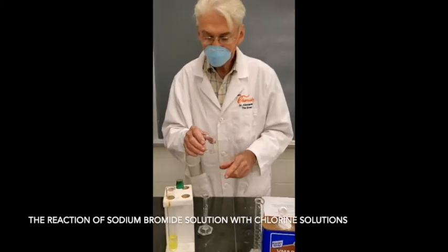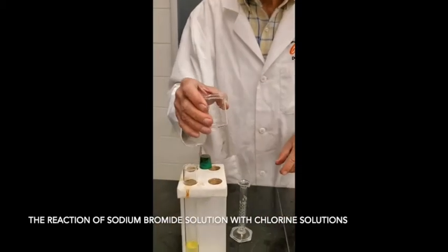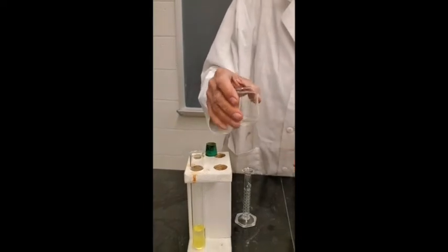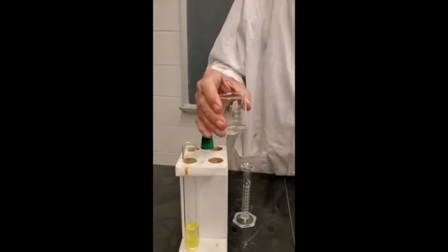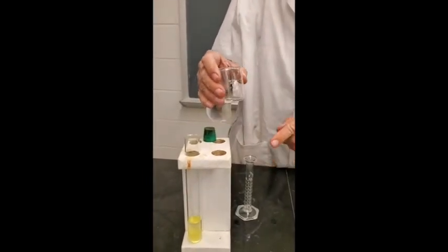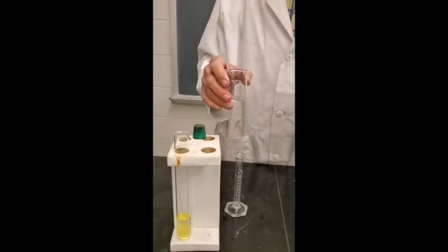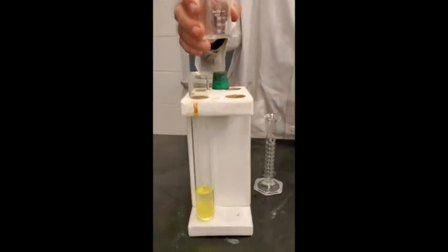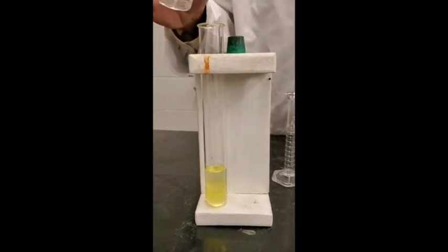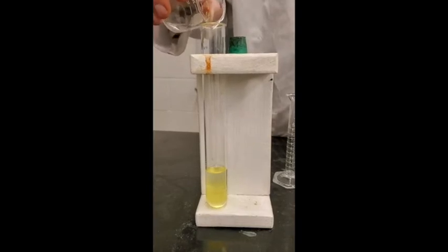Okay, what I did, I dissolved a little bit of sodium bromide in water, and since chlorine is more chemically active than bromine, it should oxidize the bromide to bromine. The chlorine is going to be reduced to chloride ions. So the chlorine, Cl2, is going to chloride ions, and the bromide ions are going to be converted into bromine because chlorine is more chemically active. And bromine is kind of a brownish orange element. Let's see if there's any evidence that we're getting bromine produced.